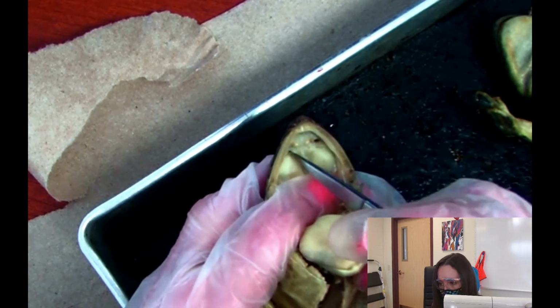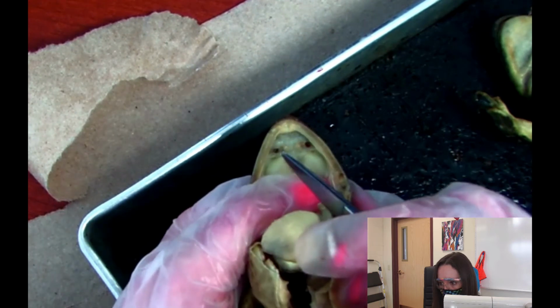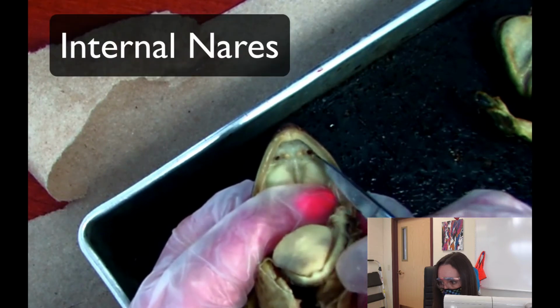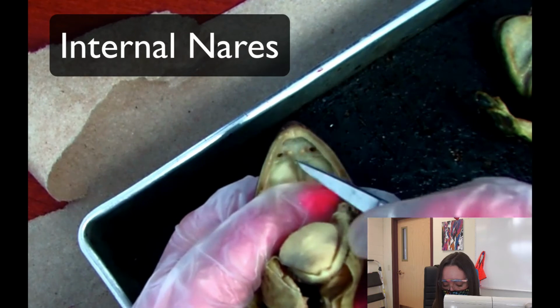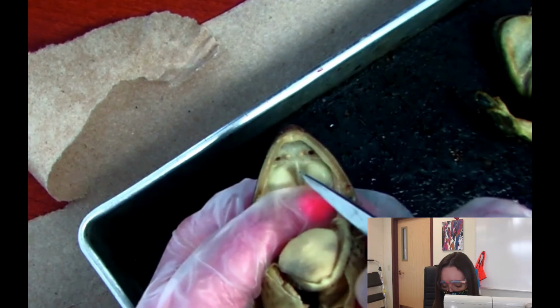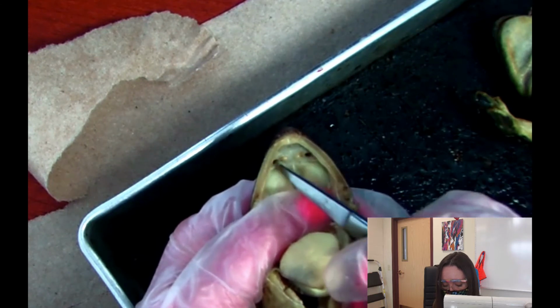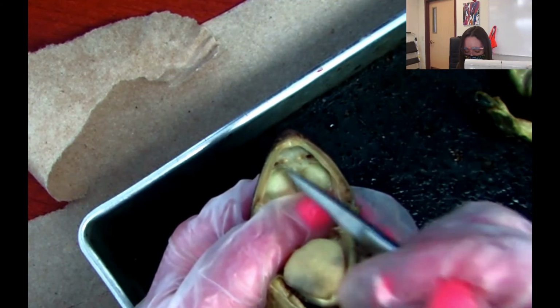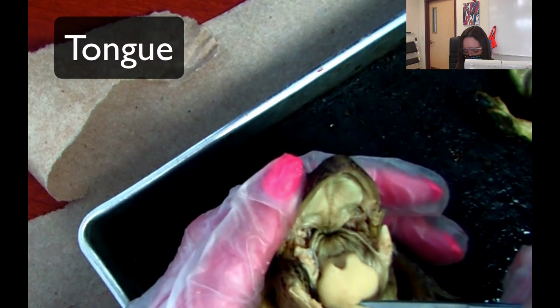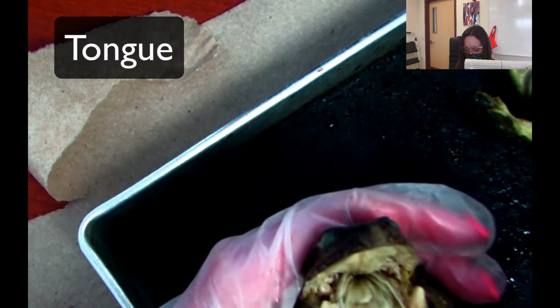These two holes right here. So do you see these two holes? These two holes are called the internal nares. So we got the vomerine teeth, we got the maxillary teeth, which are on the outer edge, and then we have the internal nares, which are these two holes right here. This part's pretty easy. So this part right here, that's the tongue. So that's an easy part. I think that'll be an easy part of the quiz.